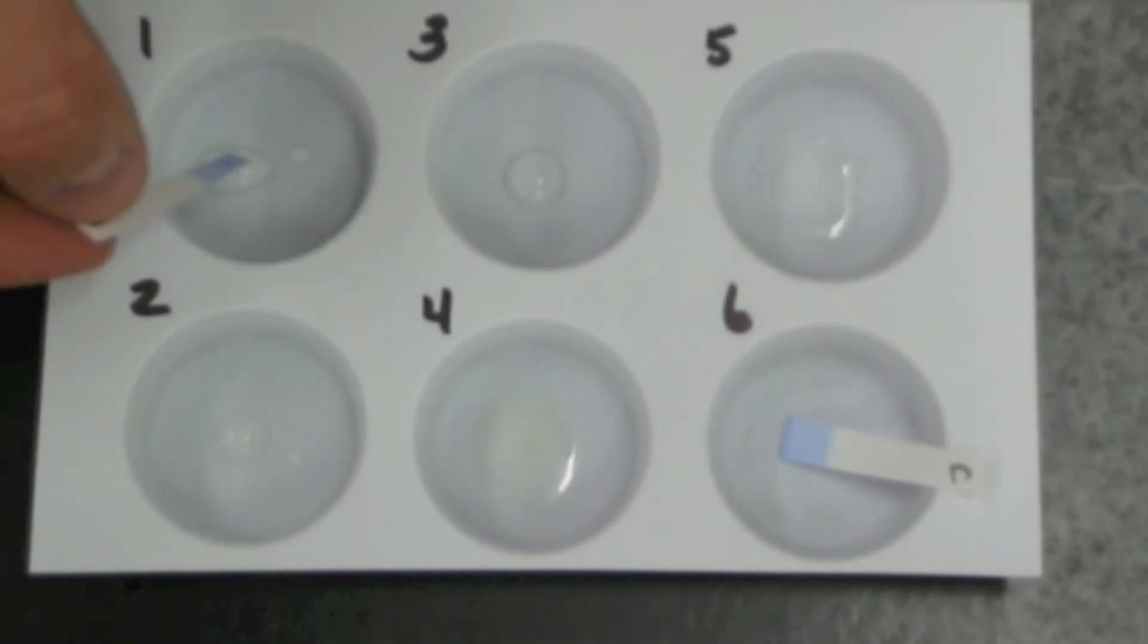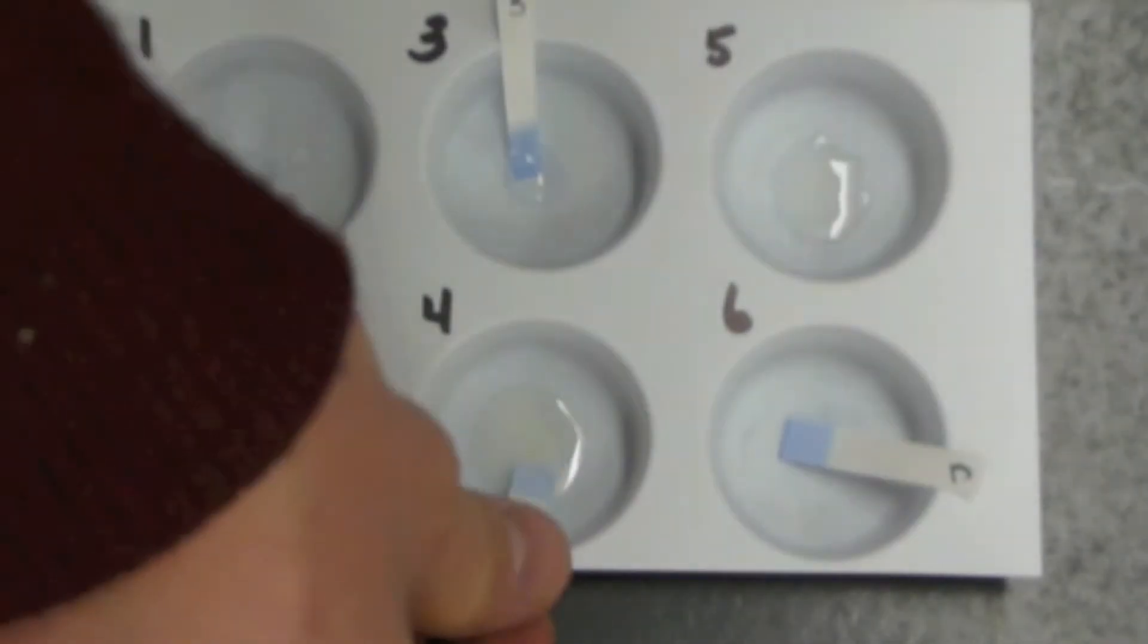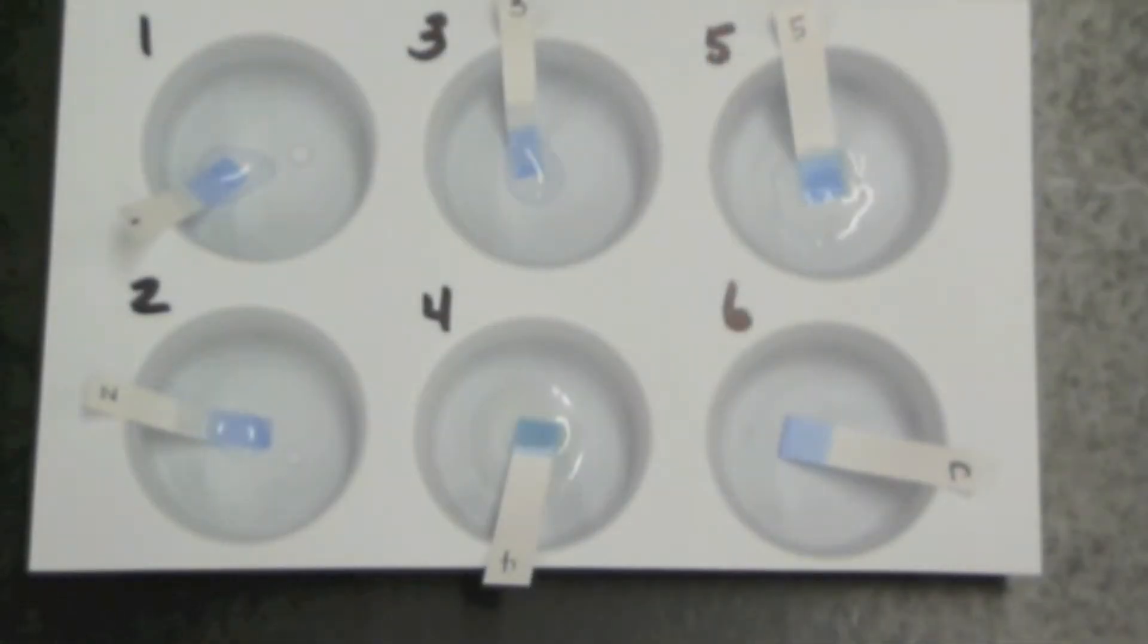Now we're going to add a test strip to each one of the liquids and let them soak. We'll let these strips soak for about two minutes.